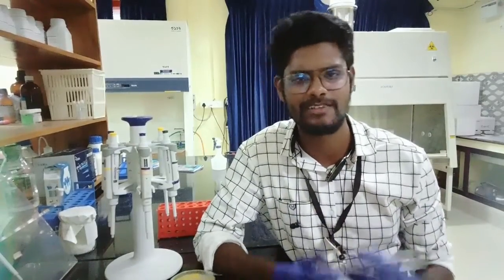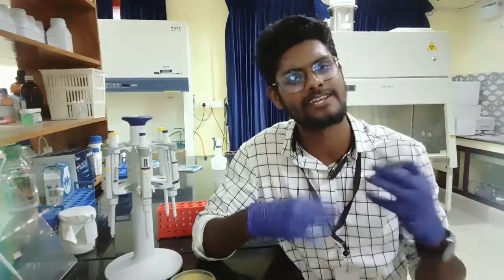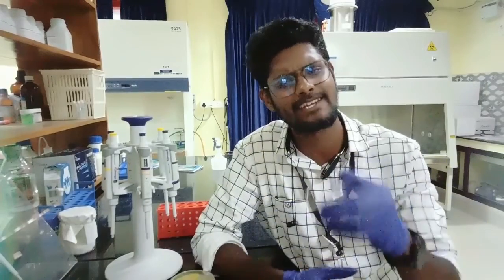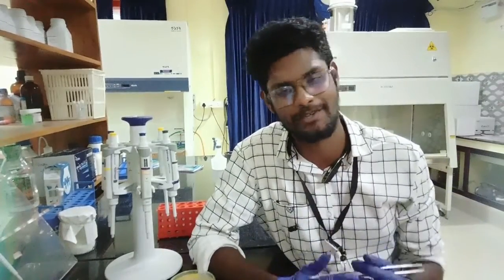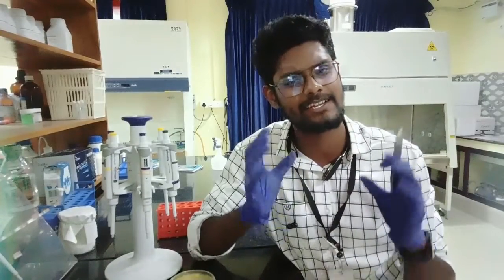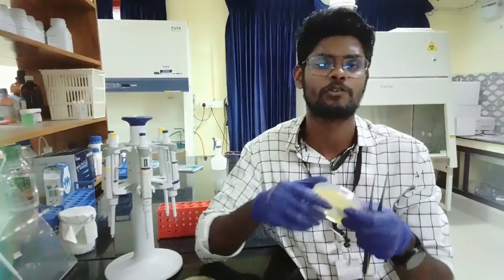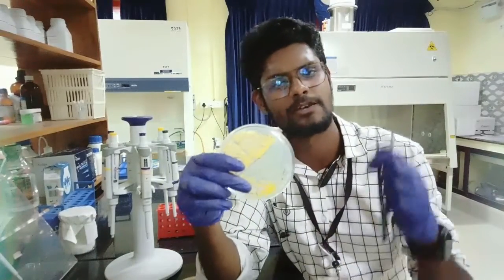In this video, we will talk about bacteria. Bacteria is very dangerous. Another basic and important topic is bacterial identification. In bacterial identification, we will talk about colony morphology study. In this video, we will talk about pure culture.